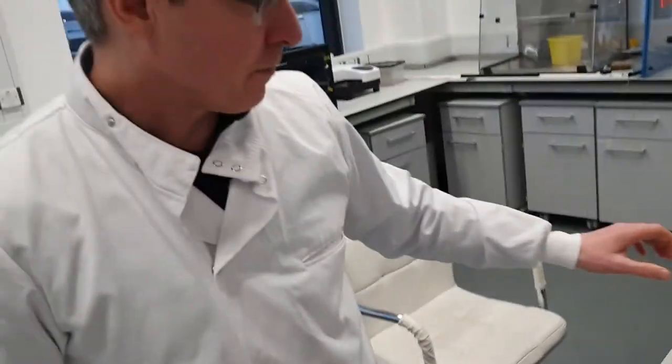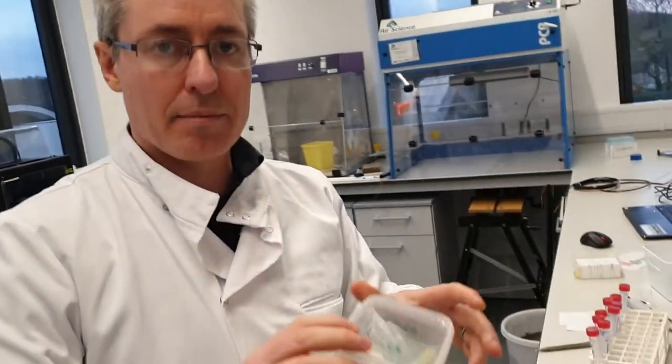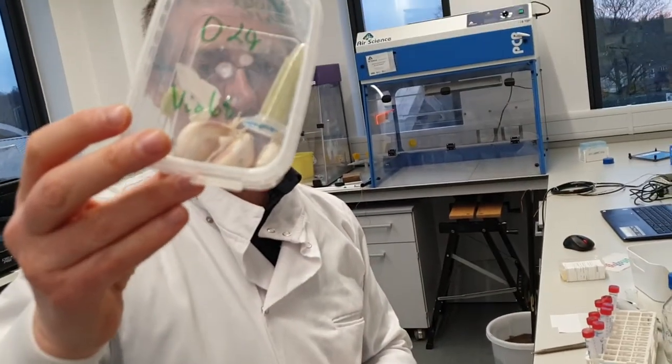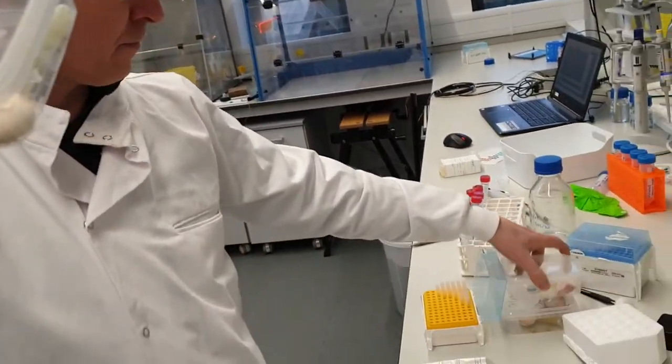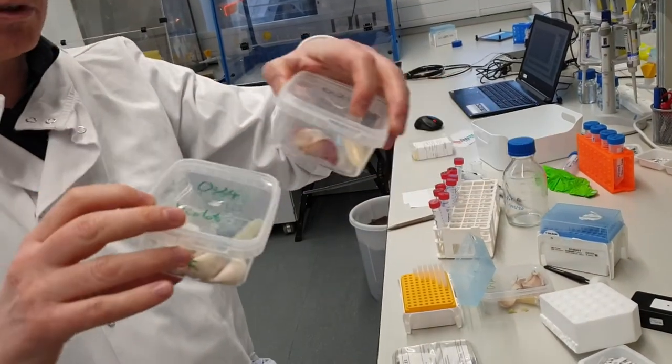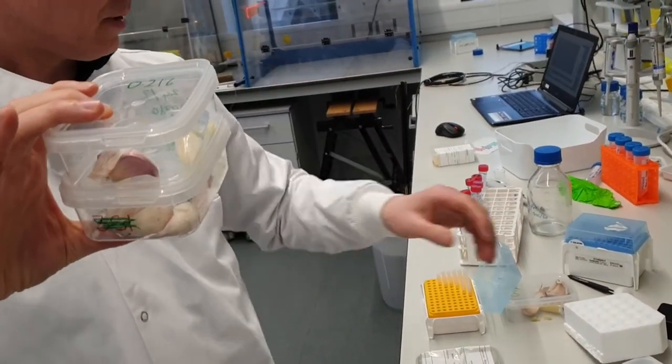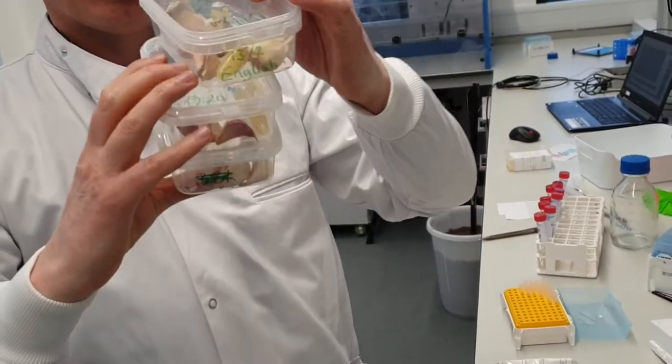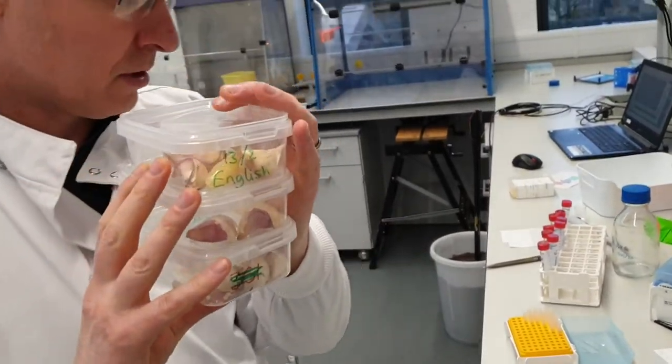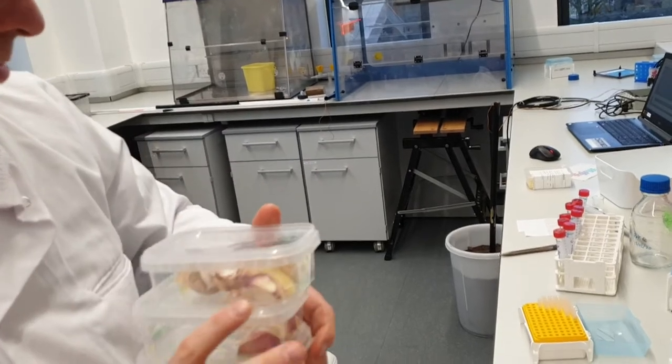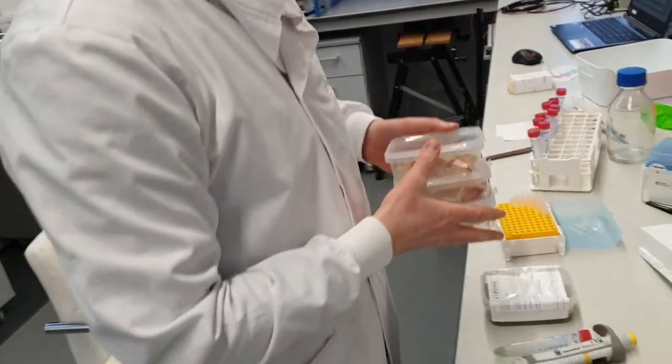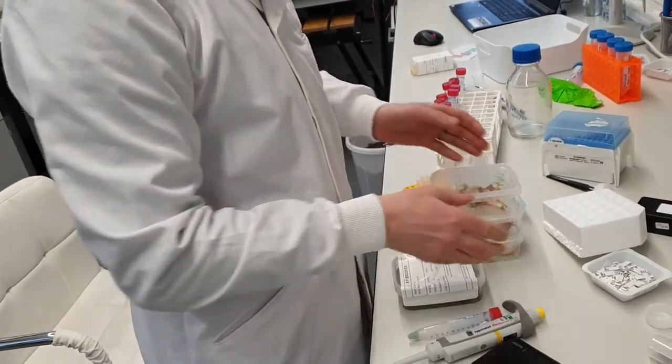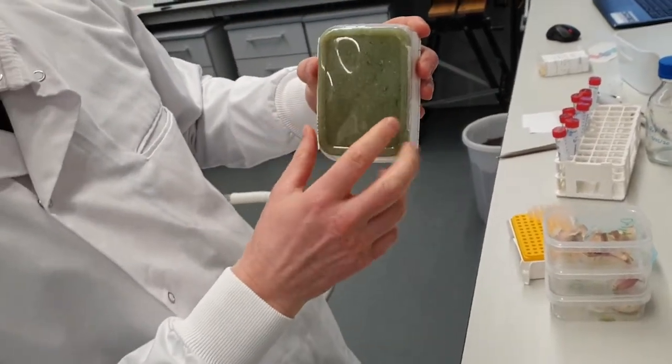So in some other videos you'll see us handling whole cloves. We've done some violet this afternoon, we've also done some Morada this afternoon, and we've also done some English this afternoon. So we've been testing a whole bunch of very pungent cloves, and we just thought we would compare it to a puree sample as well.